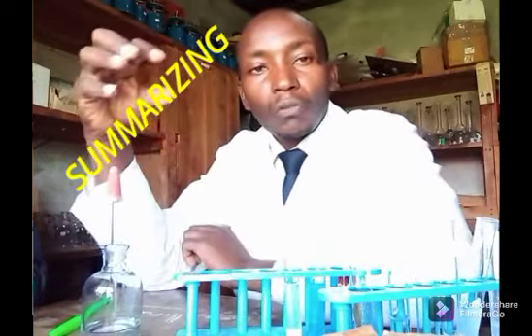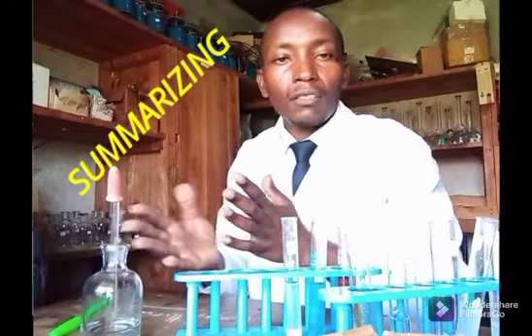I can introduce the carbonate, etc. And in the next upload for qualitative analysis, I will get you a sample question whereby I'll have an unknown substance. Then we do an analysis to identify the cations present in the unknown sample.